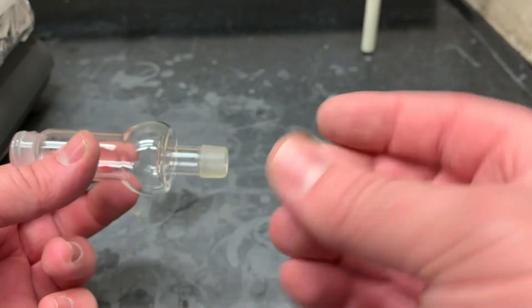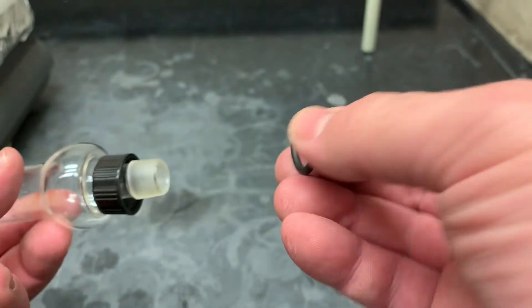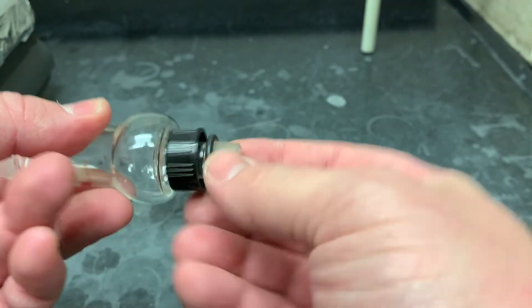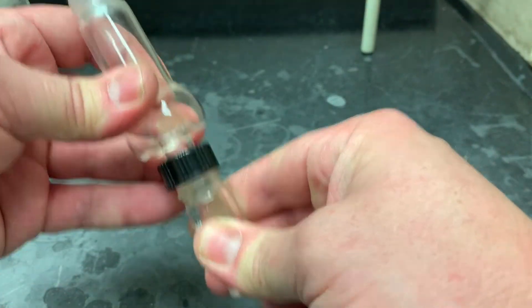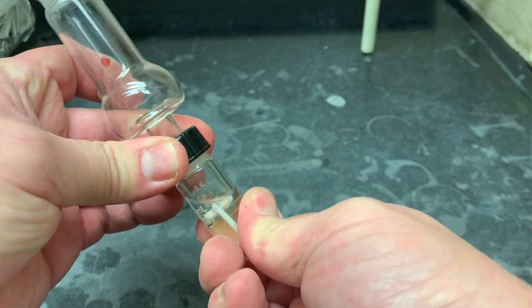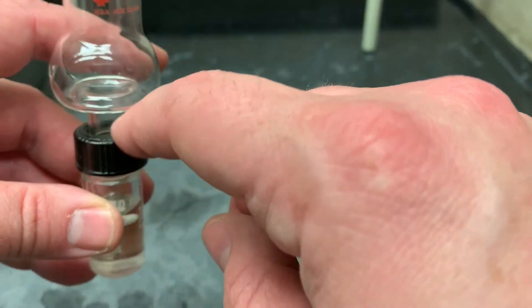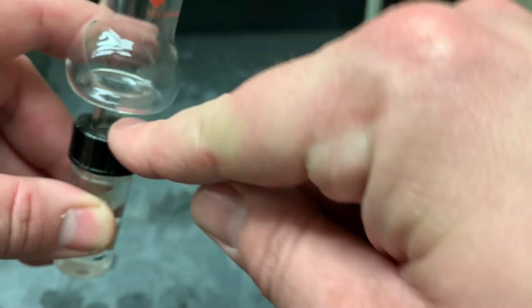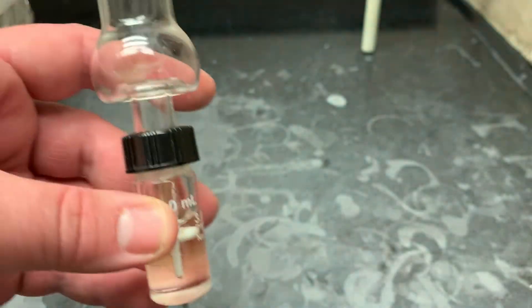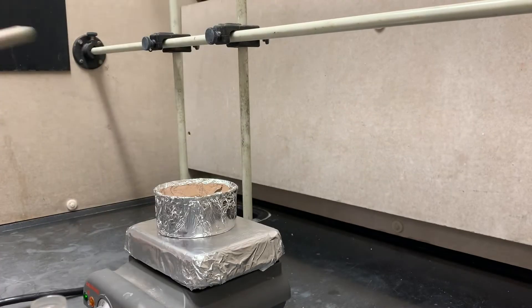Here's the Hickman, the cap with hole and O-ring. There are actually two sizes of O-ring — a thicker and a thinner one. You don't know which one you need until you try, because it depends on the exact combination of your three pieces of equipment. Screw them together nice and tight. If the assembly comes out at an angle, your O-ring is too big; if the O-ring is popping out from the top, it's too small.